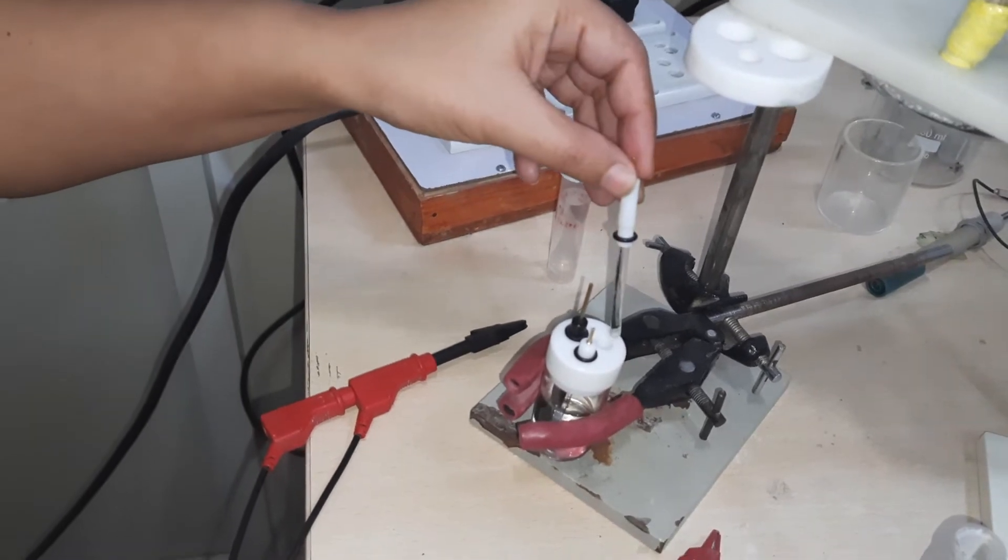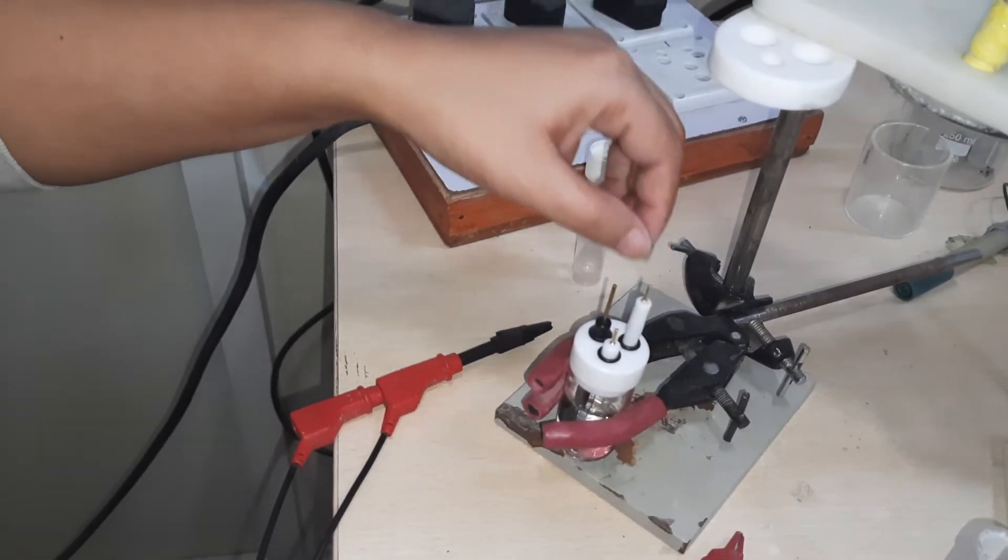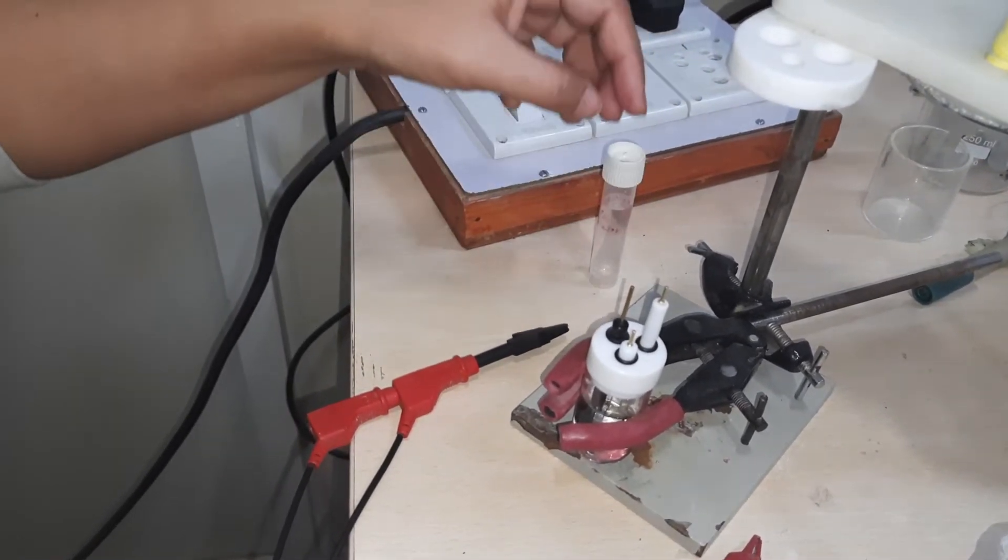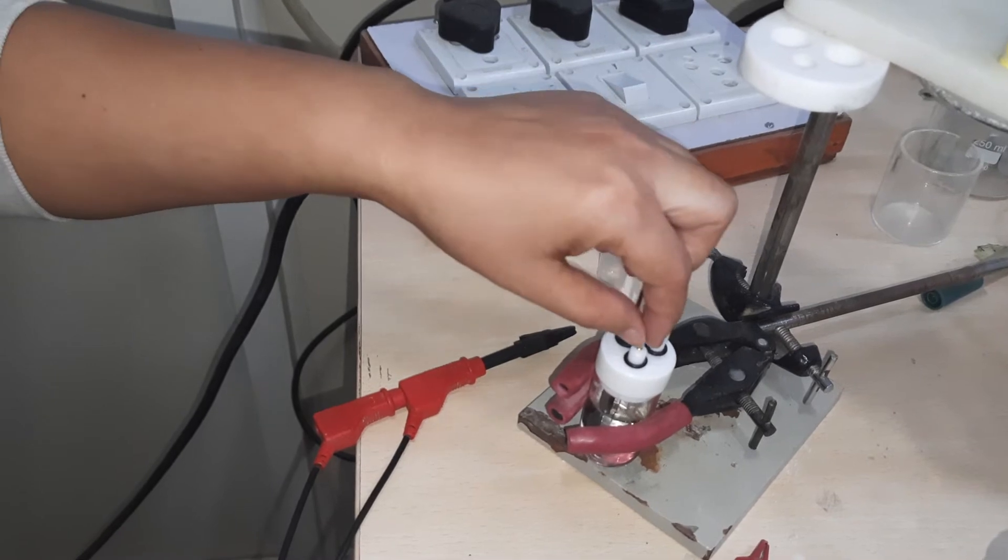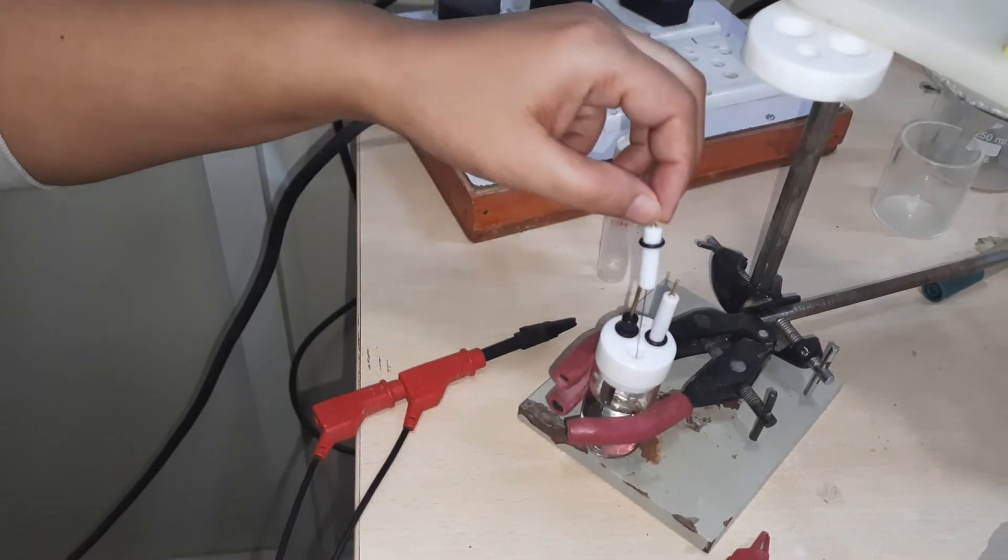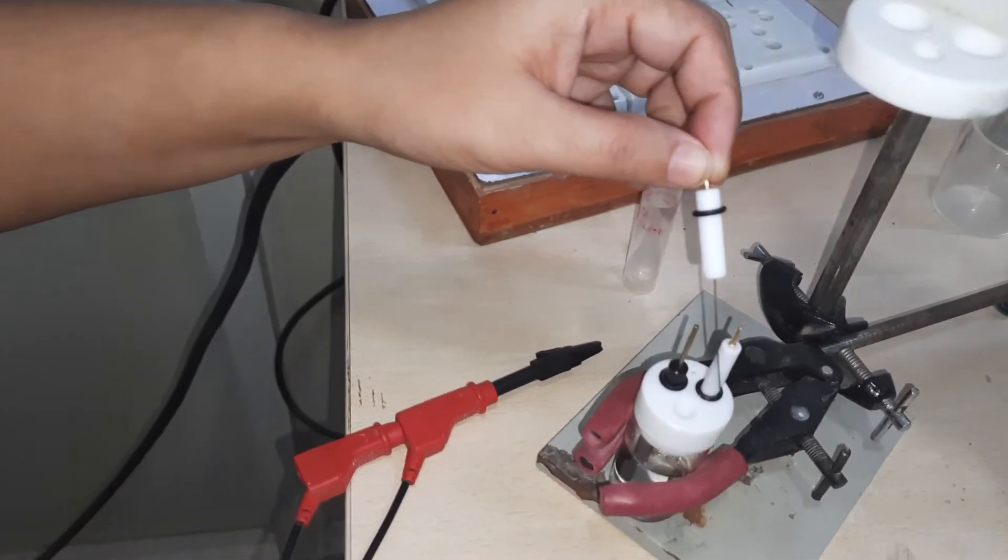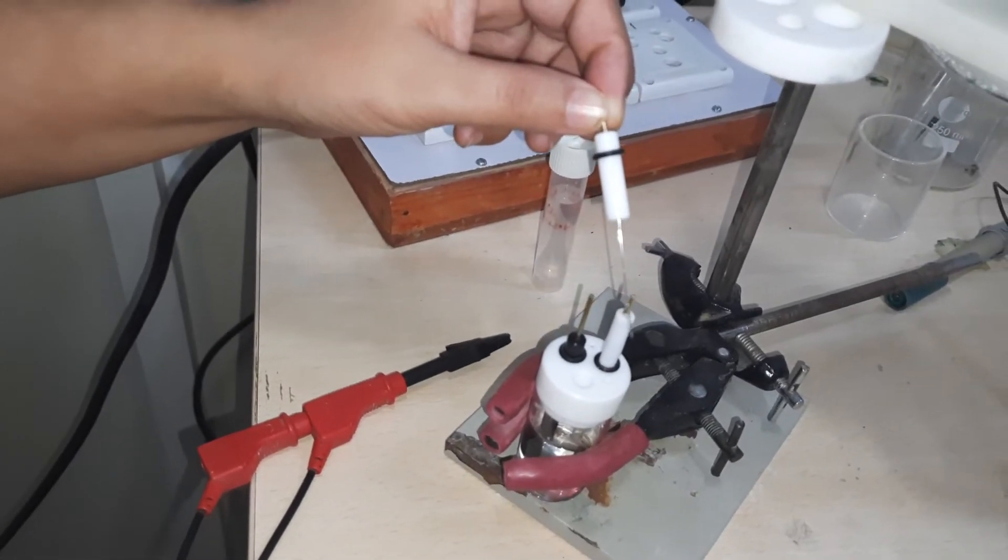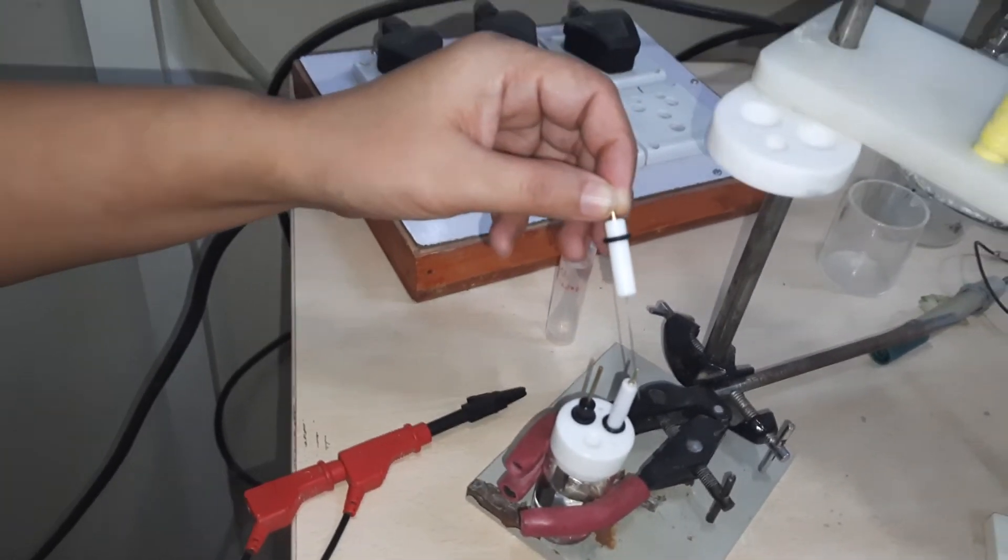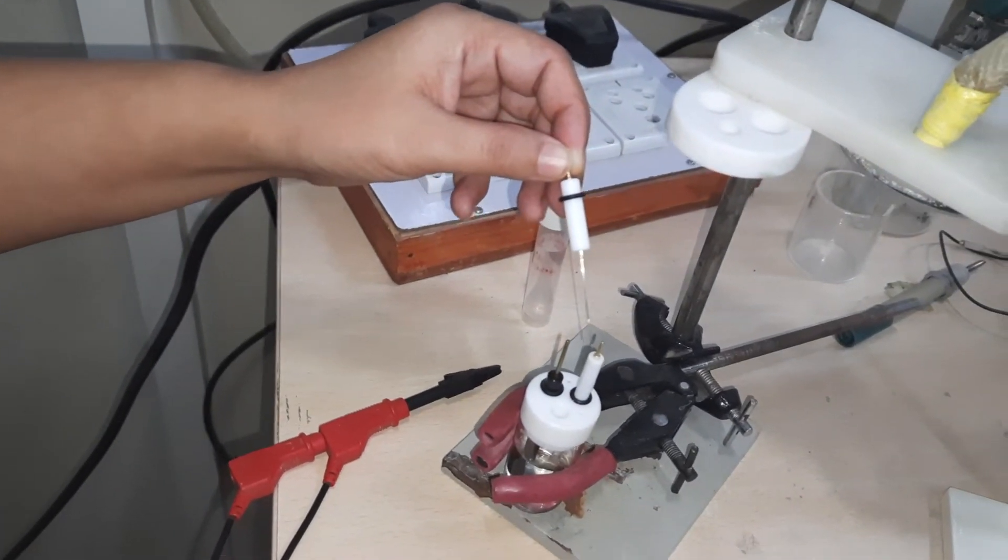Let's put it back and see the second white electrode. You can see a thin wire - this is a platinum wire, very thin, and this is used as the auxiliary electrode.